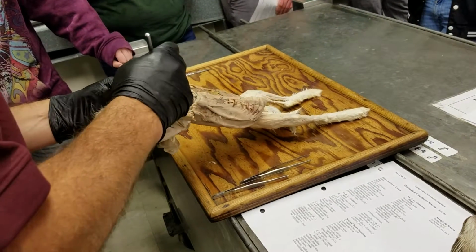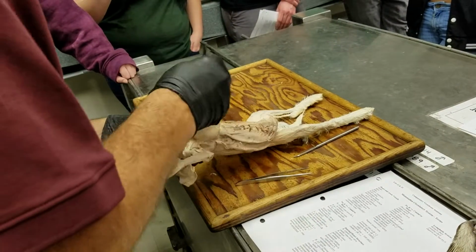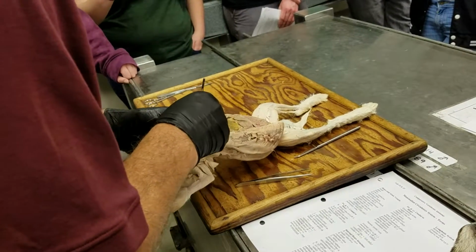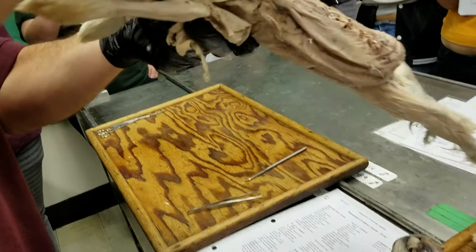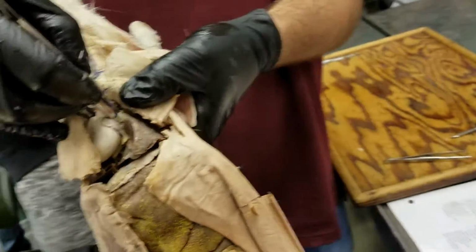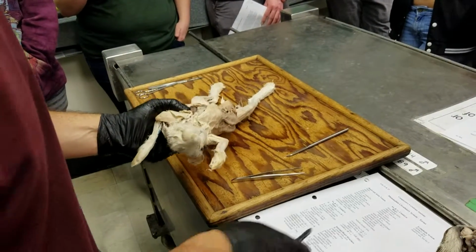If we follow the pulmonary trunk out and towards the lung, and hopefully we can see this well without injuring something here. What you can see is the pulmonary trunk gives rise to the vessel that runs directly into the lung, and that would be the pulmonary artery. So this is the left pulmonary artery here, going to the lung. And on the right side would be the right pulmonary artery. It kind of dives back behind the heart to get over to the right side.